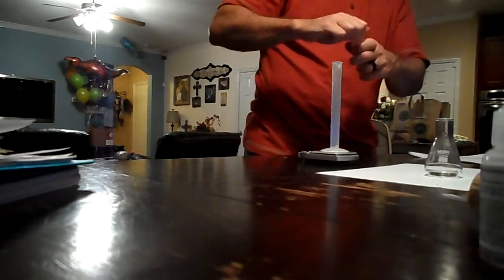I think we're gonna run out of it. Yeah, we don't have 10 milliliters though, unless we got another bottle somewhere. Transfer approximately 10 milliliters. That's a small cup. Well, we do this one and we go from there. We'll let them know we exhausted all of our solution in the previous one.